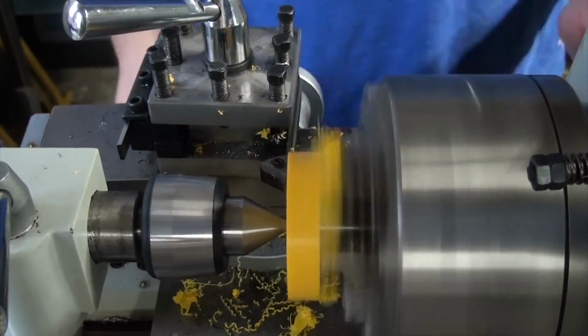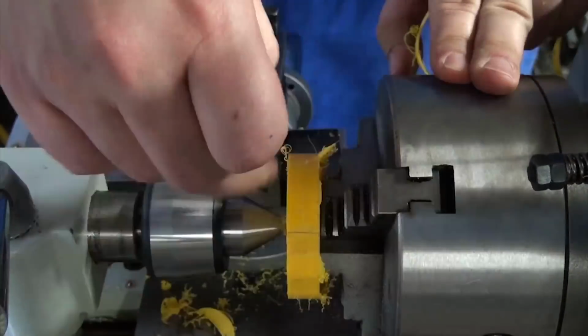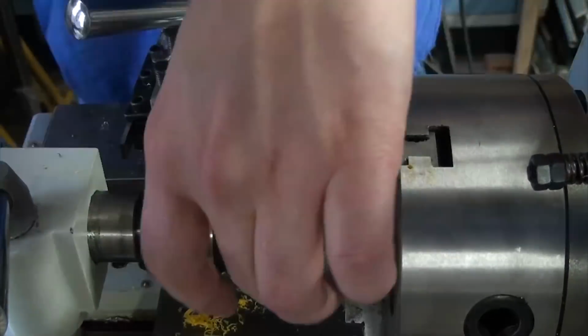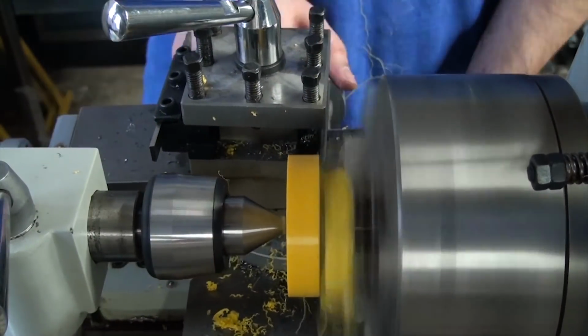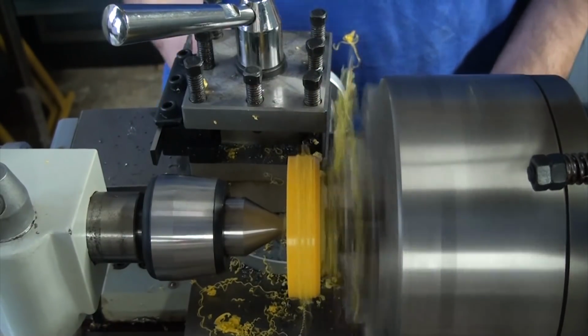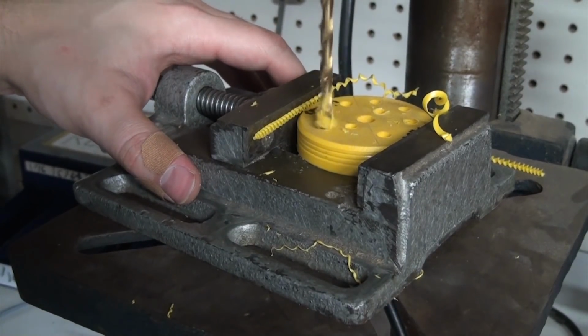I had measured the inner diameter of the lantern's top section and after truing up the plastic, brought it to final dimension. I had to take the plastic off a couple of times to check the fit to make sure it fit nicely with a bit of gap so that I could glue this in place. To help it hold, I carved a few channels into the plastic so that the glue had something to grip onto.